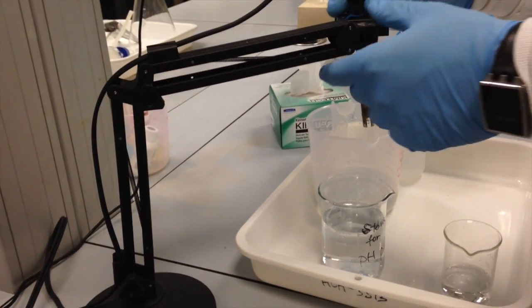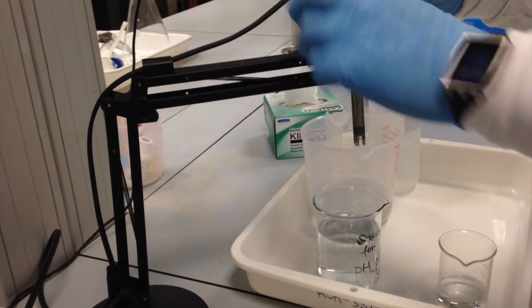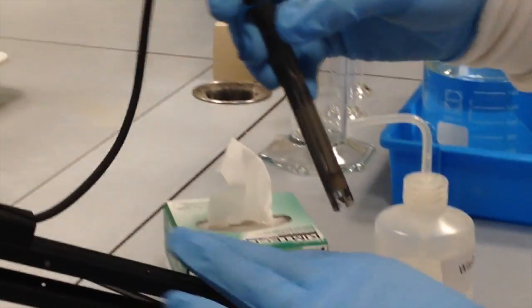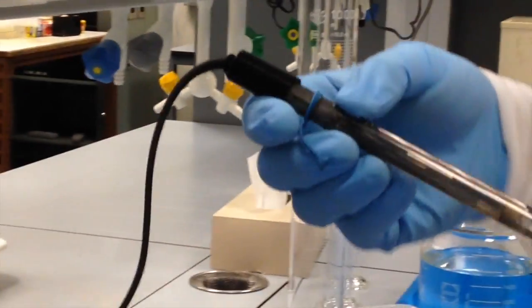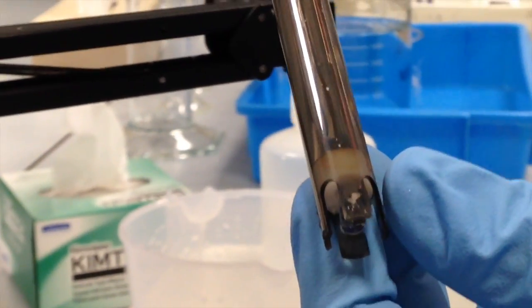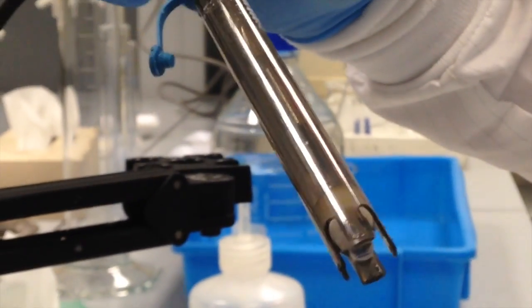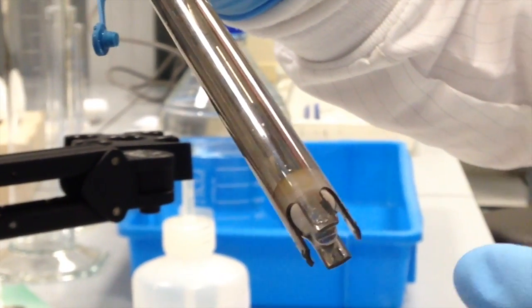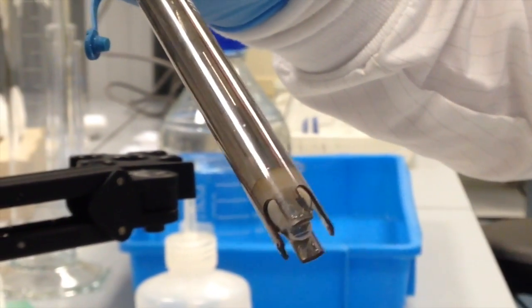There's a flexible arm that can position our pH probe. And this is the important piece right here. This is the pH electrode, which features a glass bulb at the end, which you have to be extremely careful with. If you look closely, you can see that glass bulb, and it's surrounded on the inside and outside by an electrode solution. So you can see there's a liquid inside. During this lab, you're going to be very careful not to smash the electrode bulb by treating this improperly. So you want to be very careful with the end of this probe.